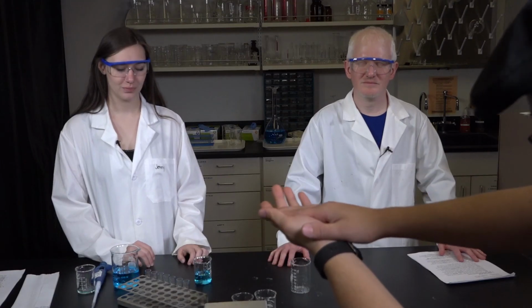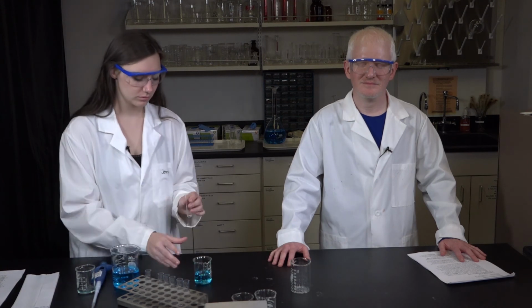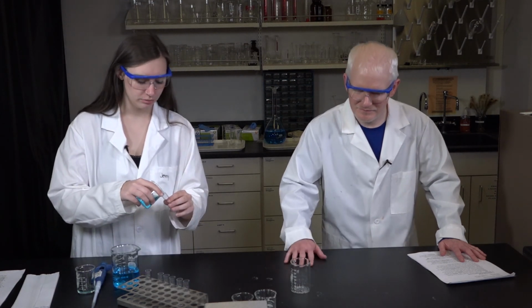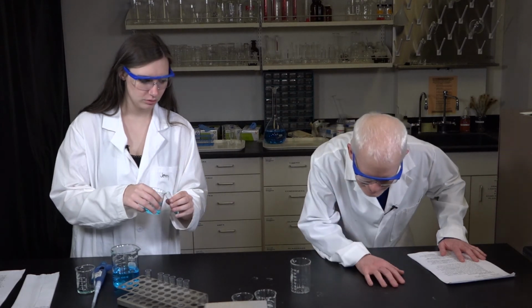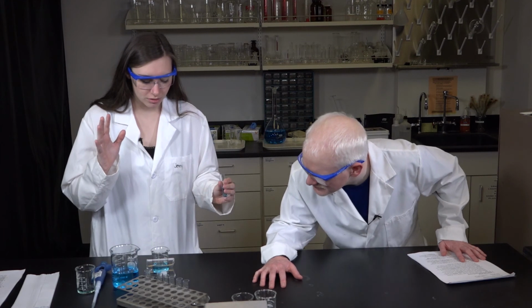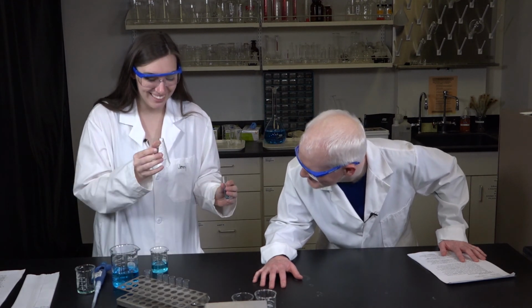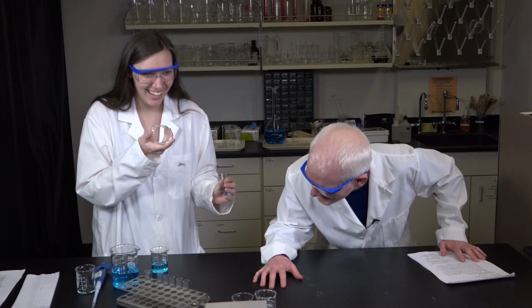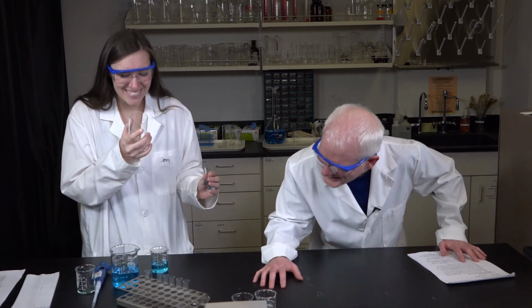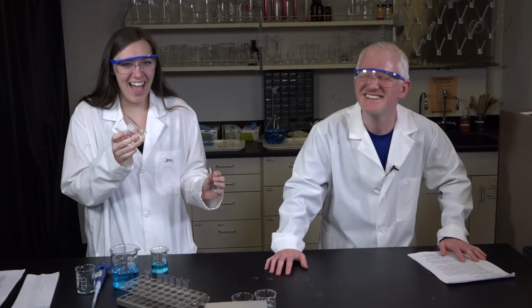Scene C, take one. Action. Can you hand me that beaker? It's right in front of you. Sorry. It broke. Cut.